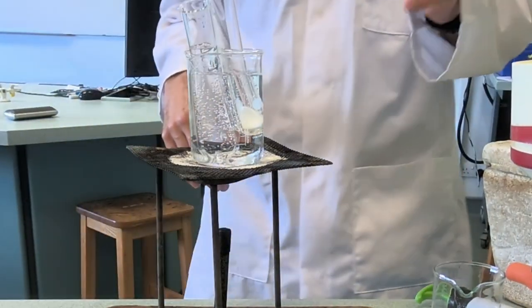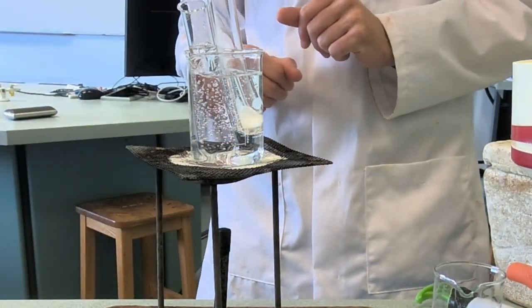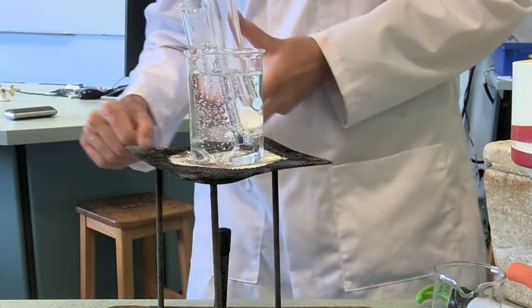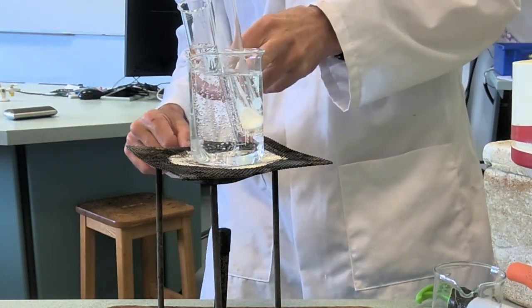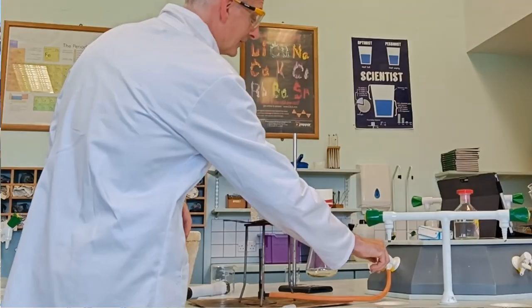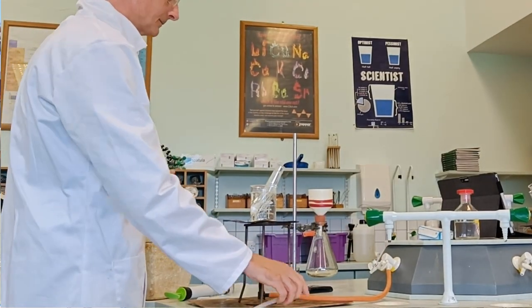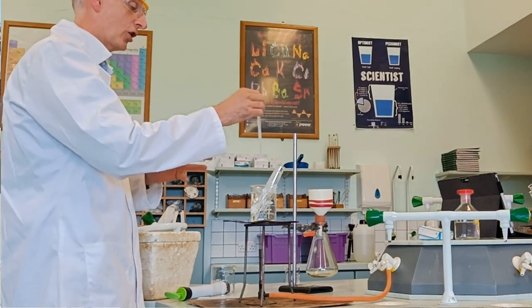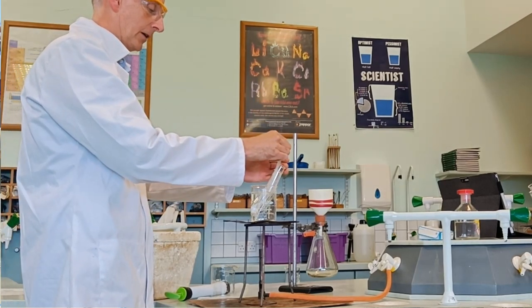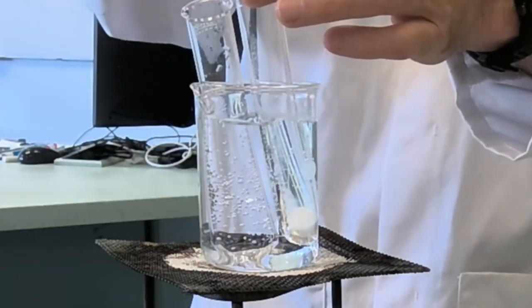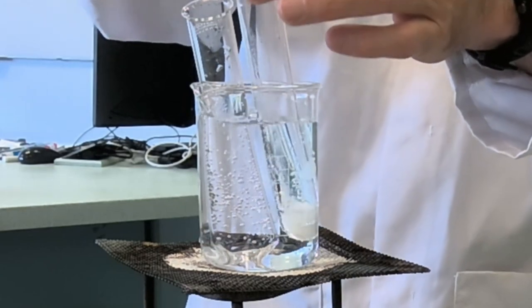Okay, so we've got a nice hot solvent at this point. Once it's boiling, the water bath is boiling, that's probably a sign you could be turning the Bunsen off. Then transfer the hot solvent from your solvent tube to your solid and try to get it to dissolve.